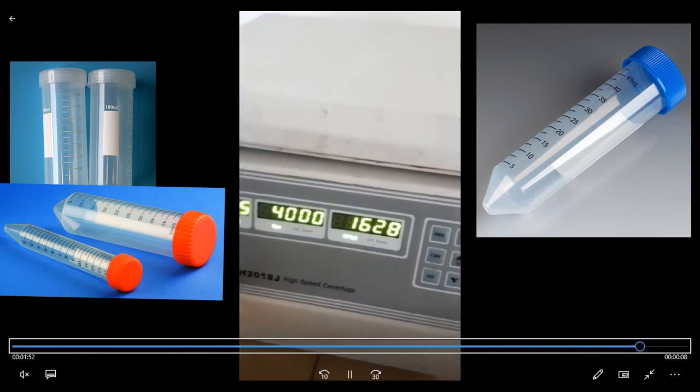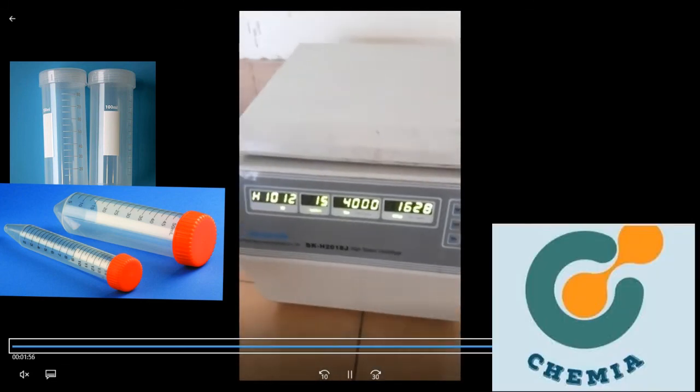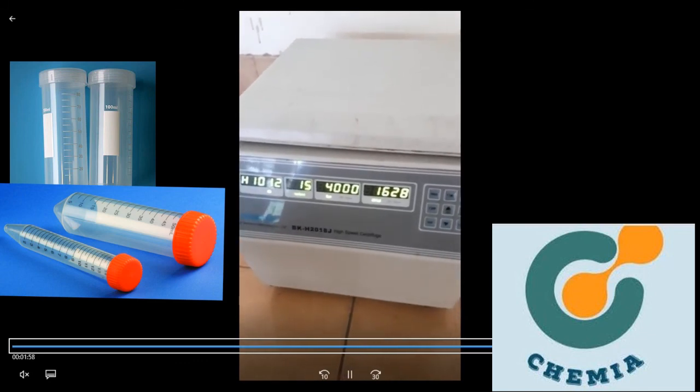Now, when all your setup is done, you have to press the start button to start your centrifuge machine.